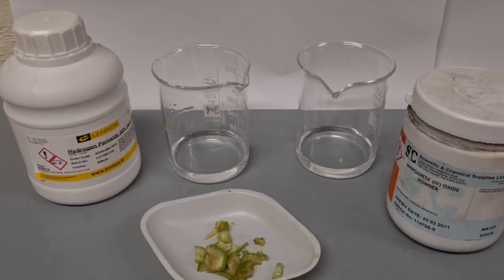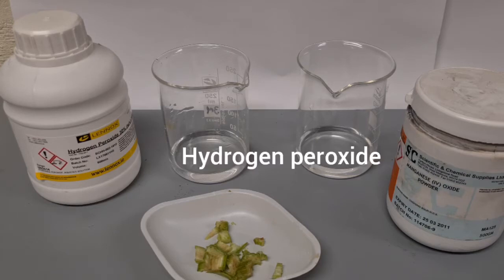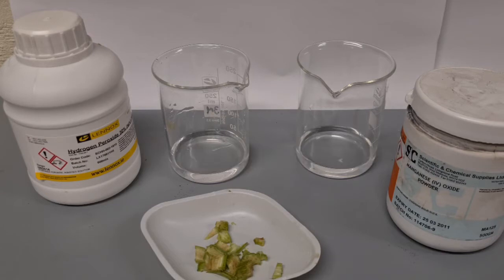The beakers contain a solution called hydrogen peroxide. Hydrogen peroxide H2O2 will slowly break down into water and oxygen.